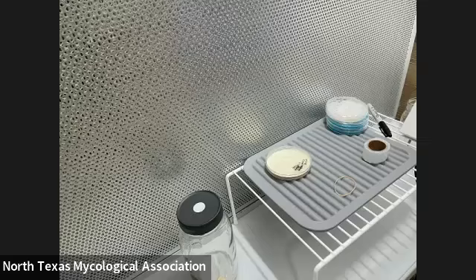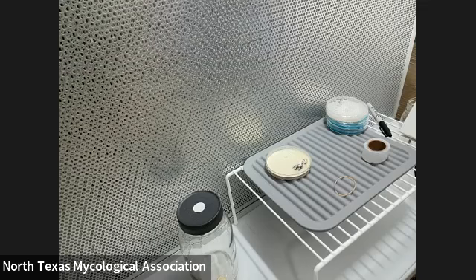That's all I'm probably going to do for the lab portion. Do you have any questions, Ava? The idea is people are going to take their own petri dish home and find some grain and try to grow their own. Yeah, that's basically the idea.